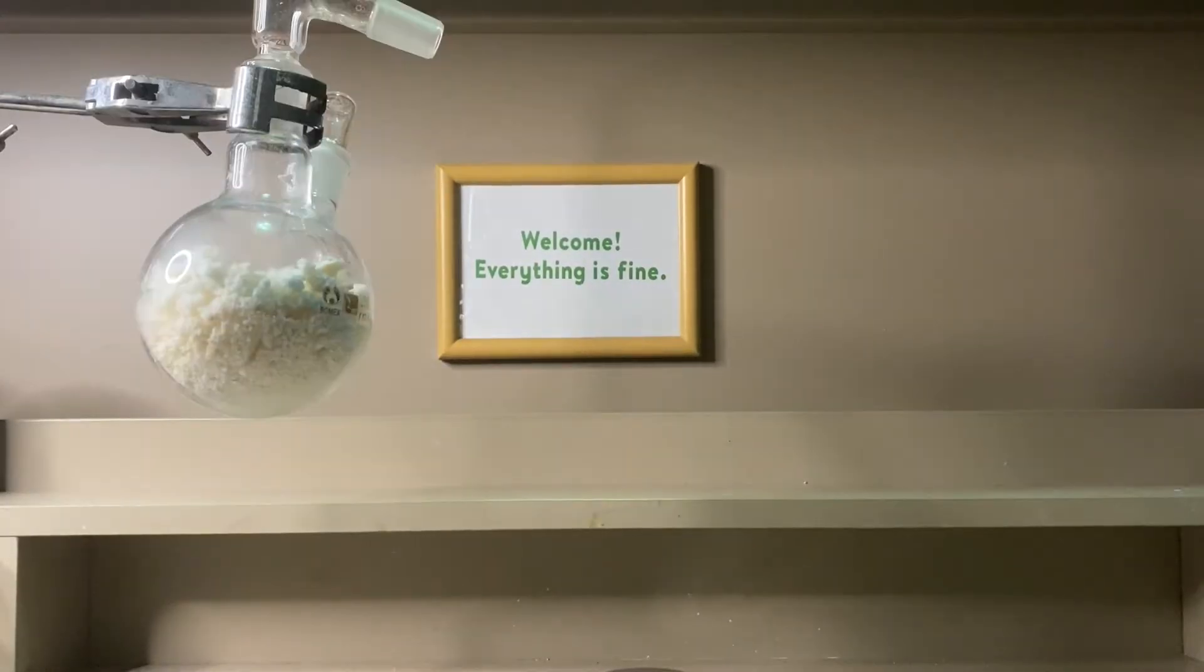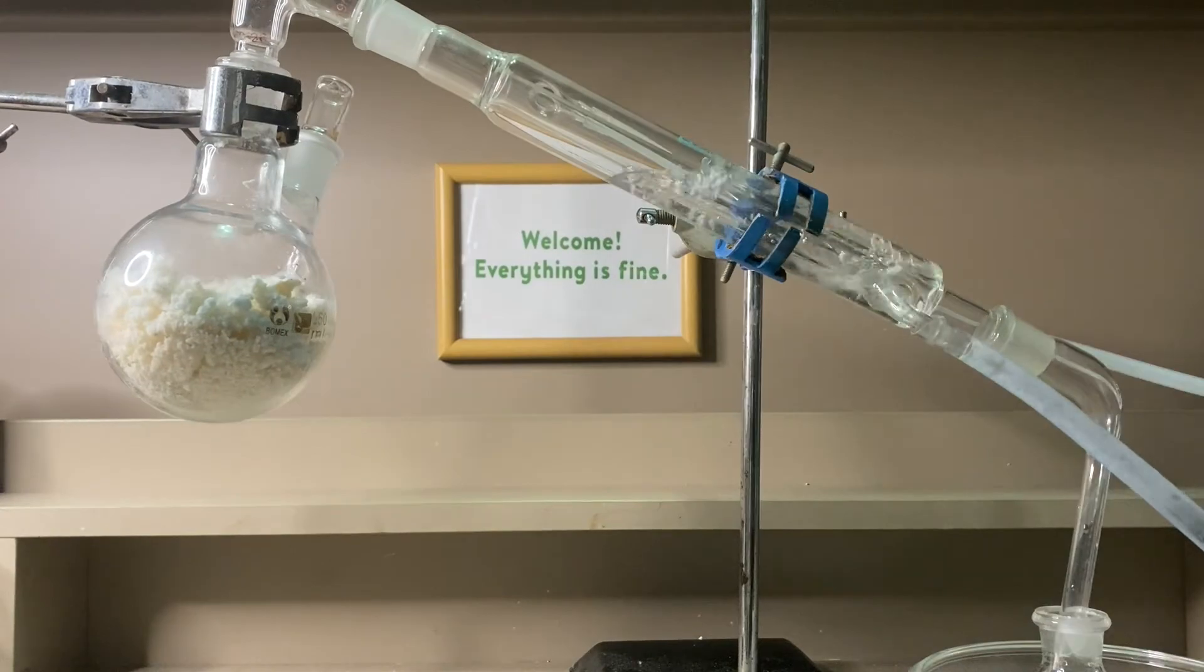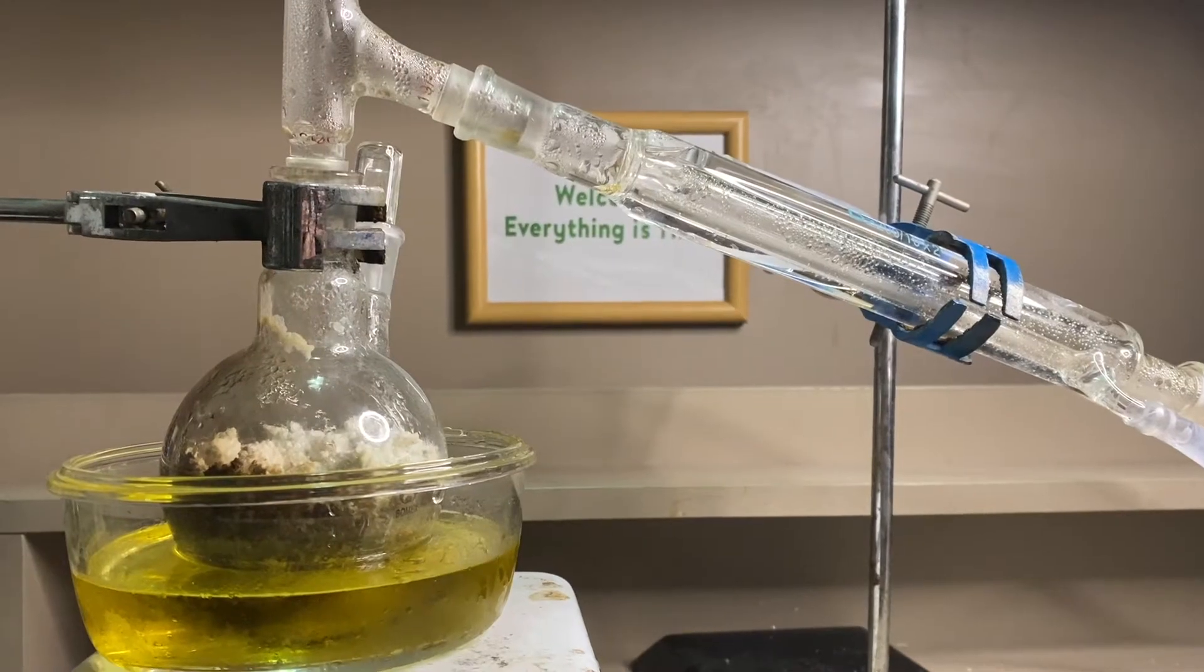We then transferred the salt into a round bottom flask and constructed a distillation setup, performing the distillation in an oil bath.